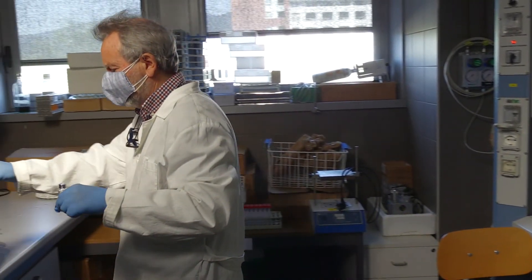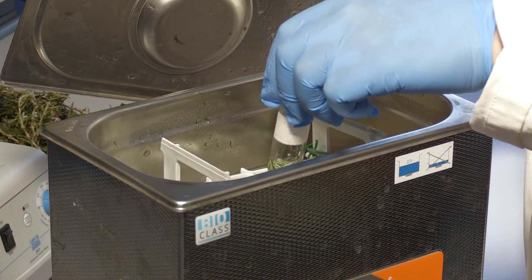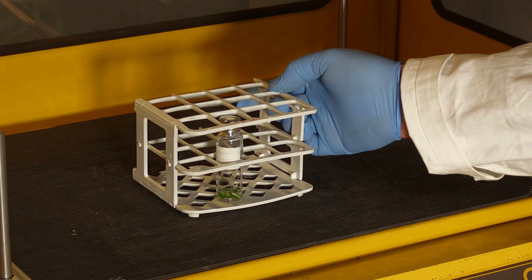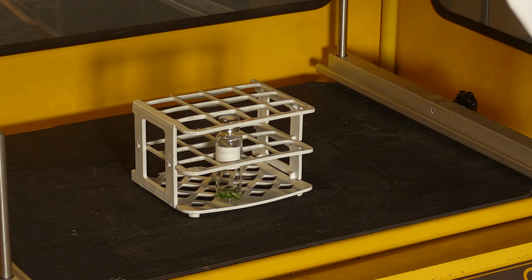The sample undergoes three cycles of sonication and then is kept under rotary agitation for 24 hours.